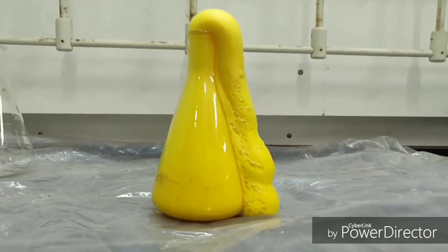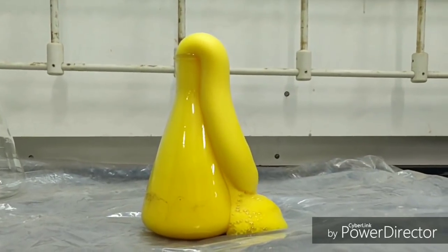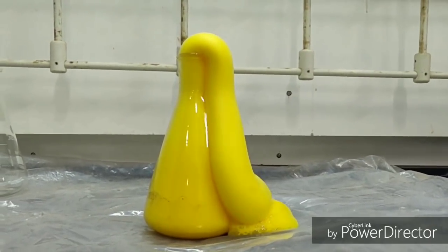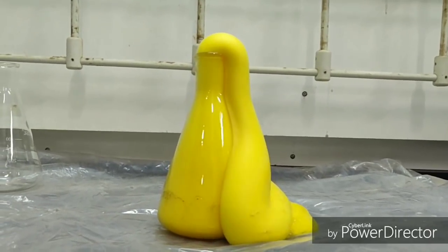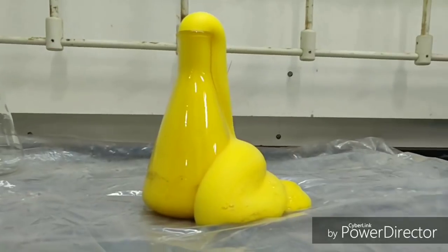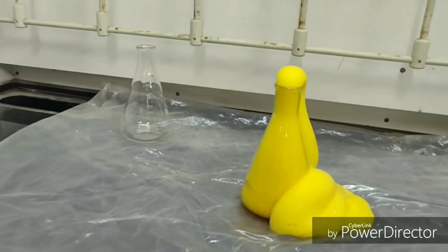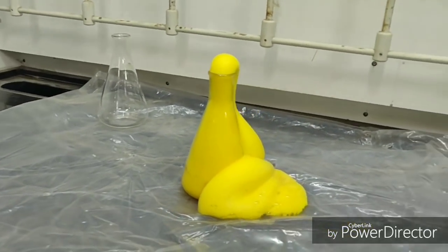As we can see, the nice yellowish foam is coming out of the flask. As we can see, it keeps on going on and on.